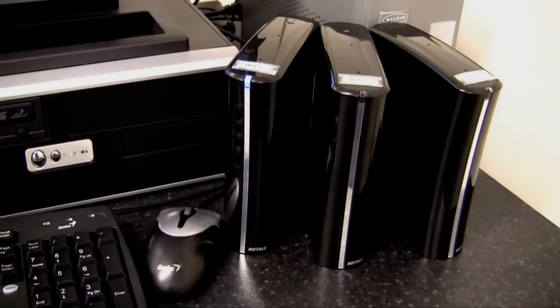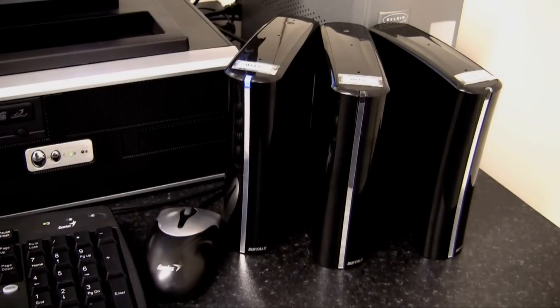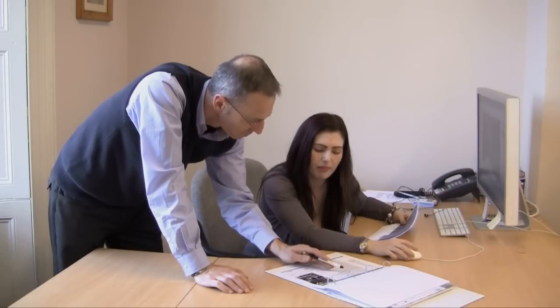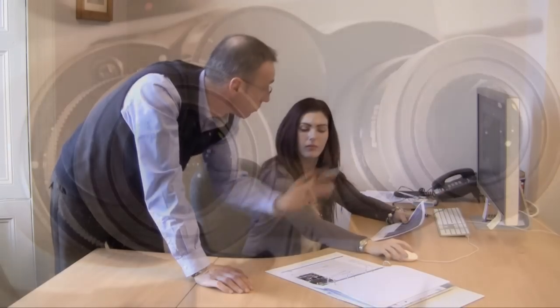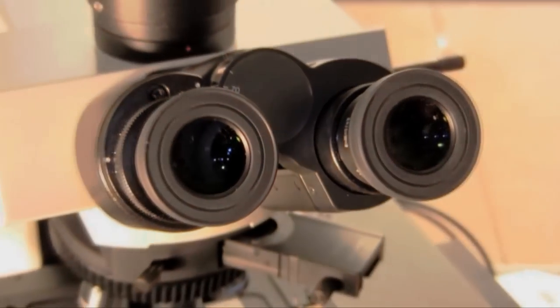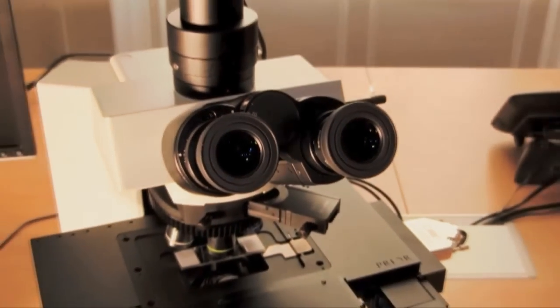This image can be very useful to create a permanent digital archive of the thin section, collaborate effectively with partners and third parties, visualize heterogeneity in detail, and finally perform a variety of image analysis techniques.